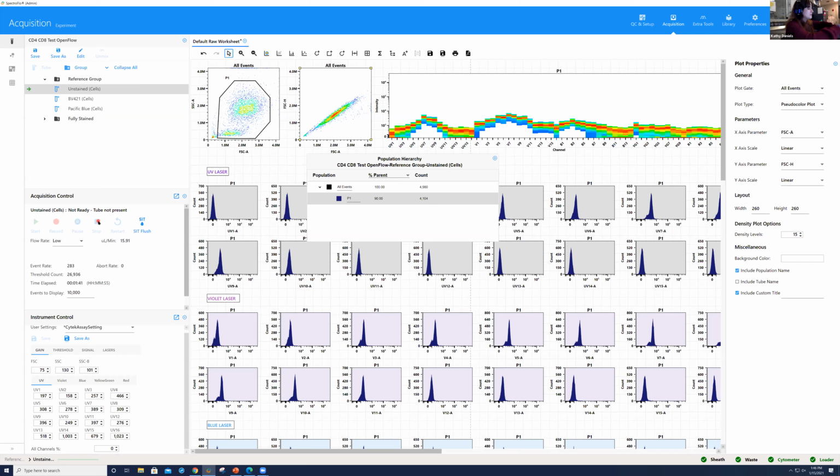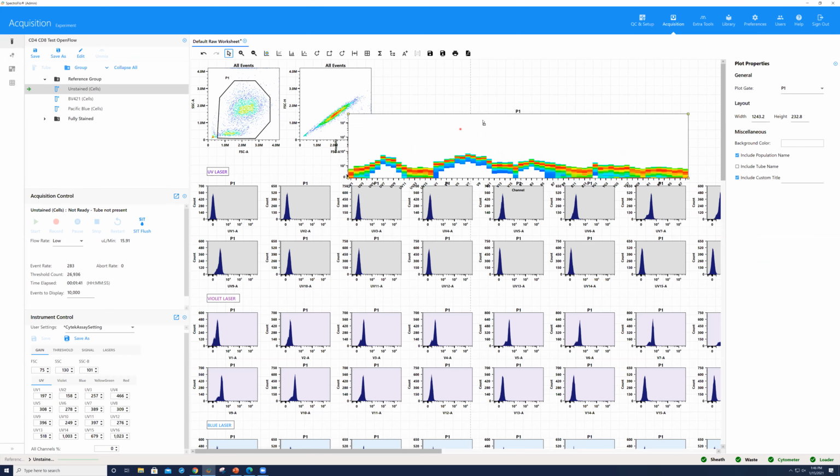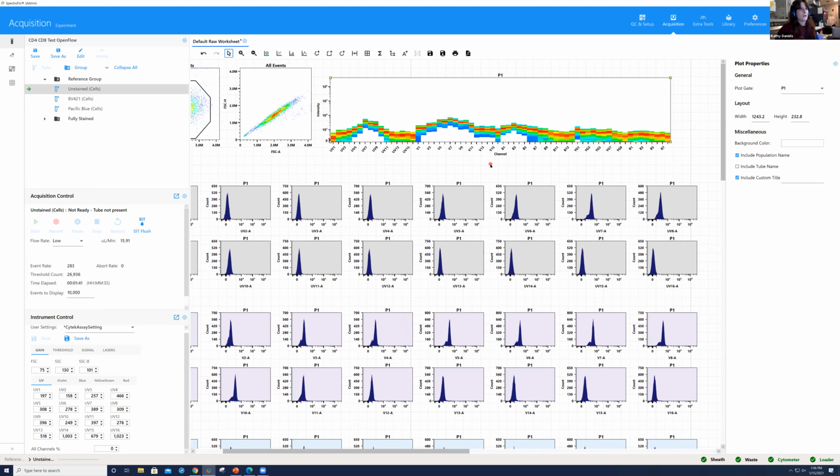Okay. We did talk about this last time, but it's very important to stress that we are looking at the full spectrum, right? So I'm going to close this out for now. When we're looking at this full spectrum plot, if I put a sample on and you had a signal that was off scale, off of a certain laser line, what you never want to do on these units is change individual gains unless you've had a conversation with someone from Cytek, as there are special applications for this. Like I said, listen to your representative.